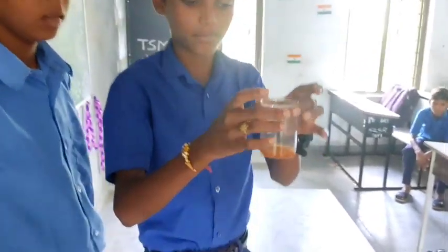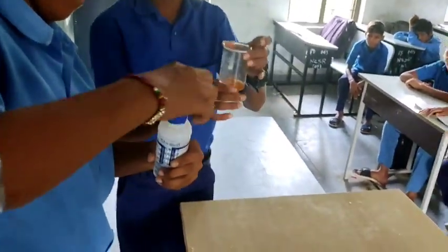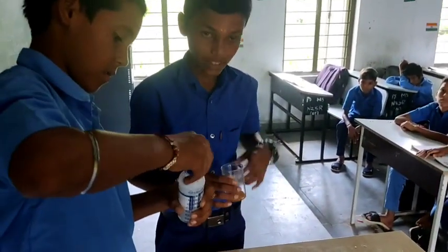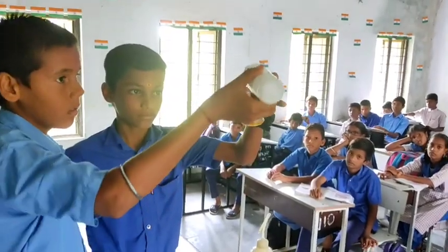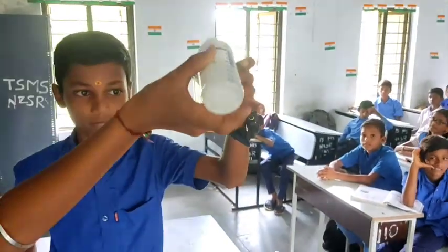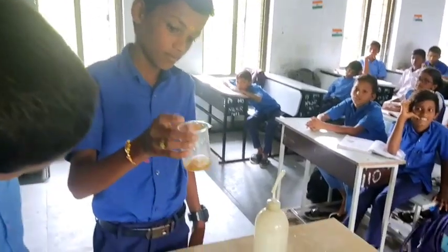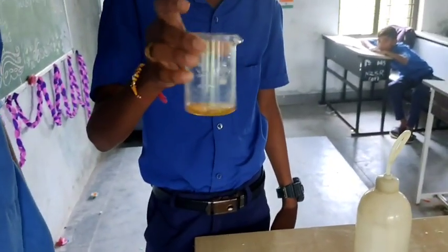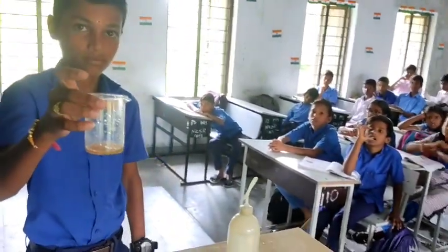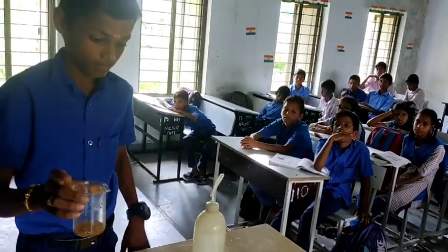Now we are going to test with Phenolphthalein. We take fresh Tomato Juice in a beaker and add the Phenolphthalein solution — it is already colorless. We check for any color change. The Tomato Juice has not changed its color with Phenolphthalein. This means Phenolphthalein remains colorless in the presence of an acid, confirming that Tomato Juice is acidic.